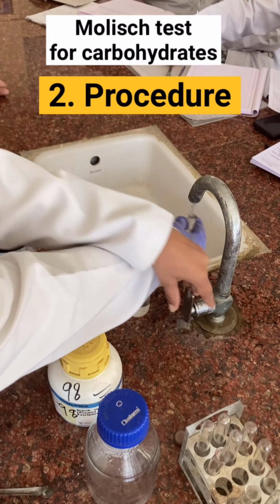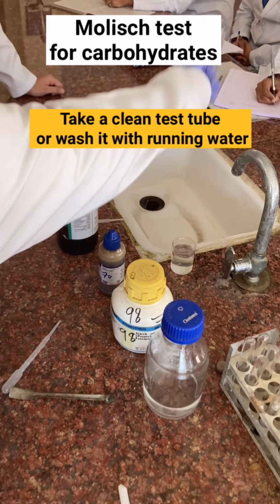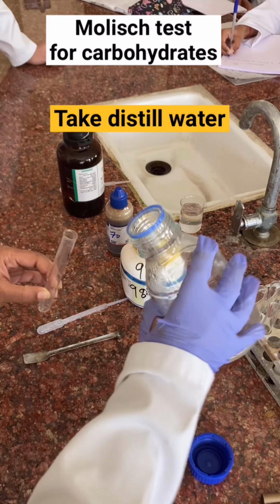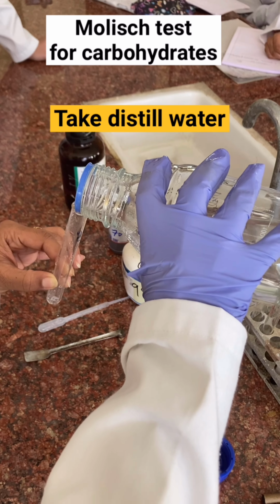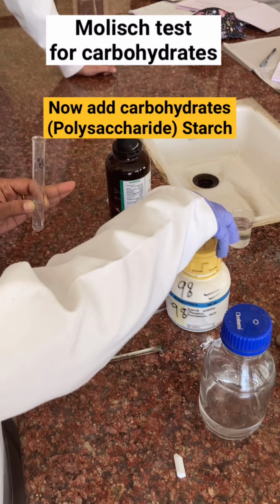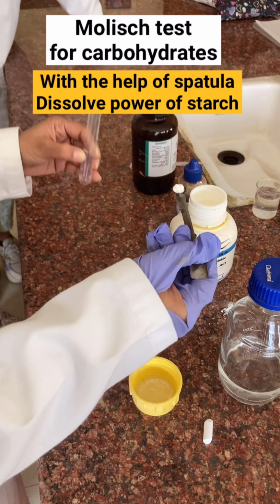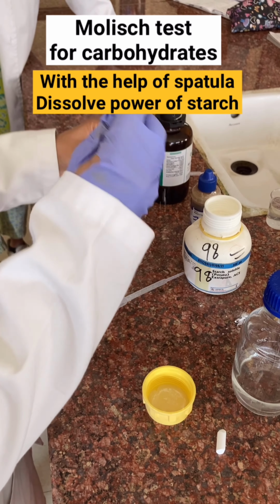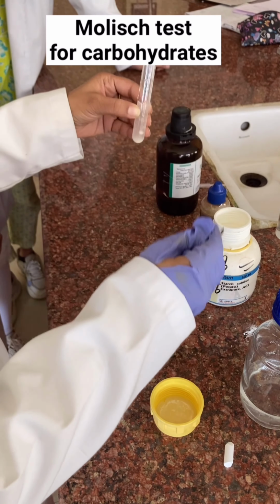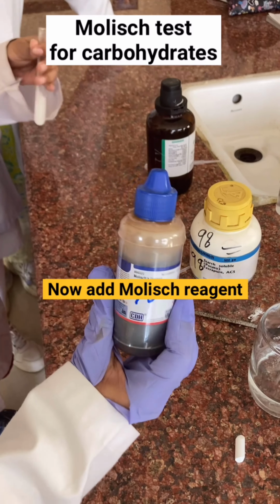For procedure, first you need to take the test tube and clean the test tube with running water. Then you should be adding the distilled water into the test tube. Now you have to add the starch powder or any carbohydrate. We are using the polysaccharide, that is starch. And after putting the starch powder into the distilled water, then you should be mixing it thoroughly.